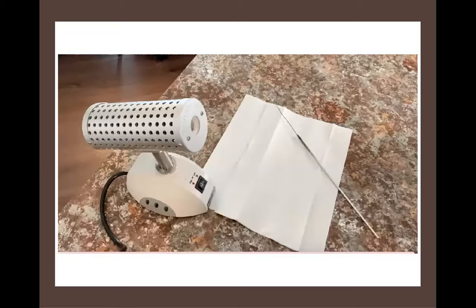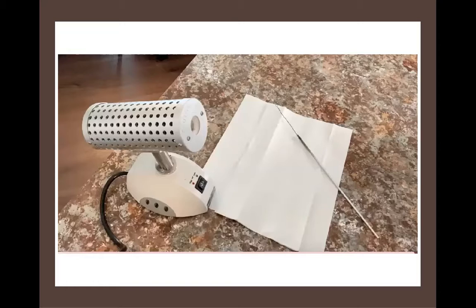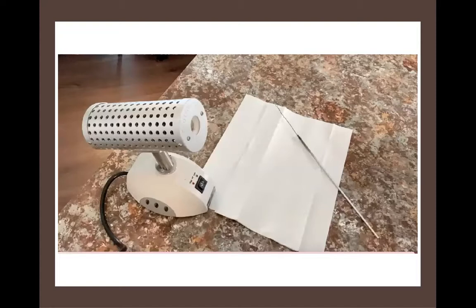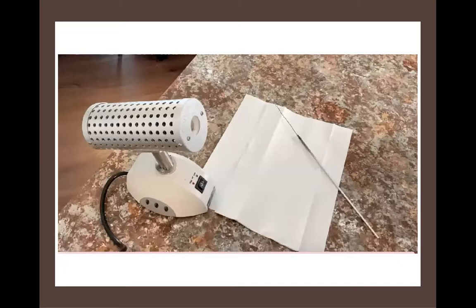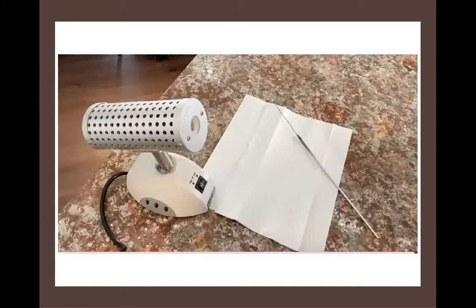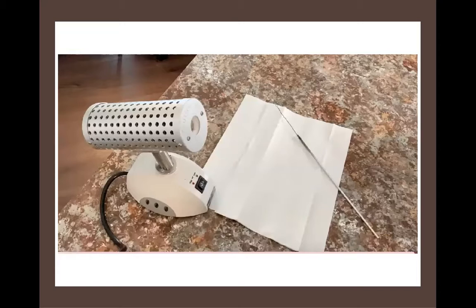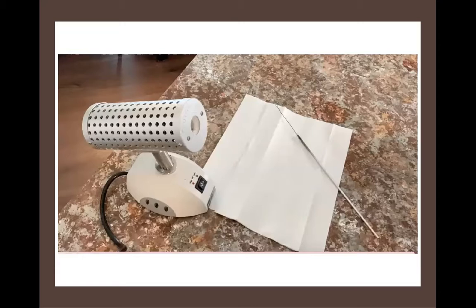There are really two primary types of culture containers we encounter most often in the laboratory: test tubes, which can have liquid media, semi-solid media, or even solid agar in them; and the petri dish — the plastic, single-use, lidded dish that we often refer to as a plate. Agar plates have a thin layer of solid media on the bottom. Those are the two containers we encounter most and move cells between most often. The video will show how to do all of that moving using our best aseptic technique.